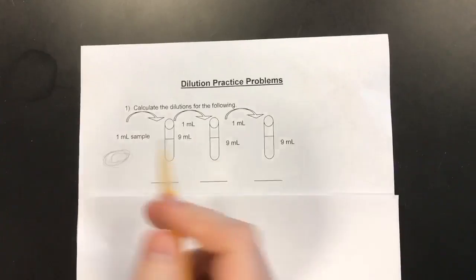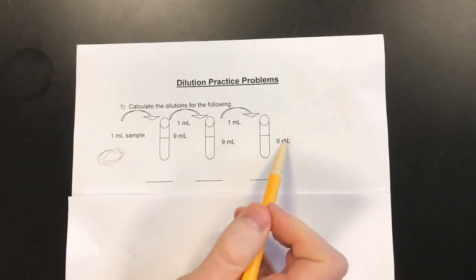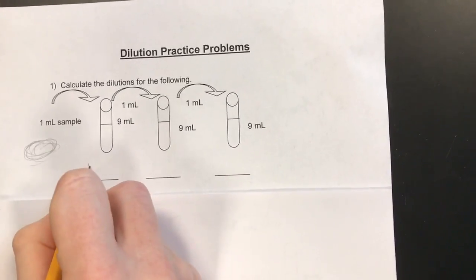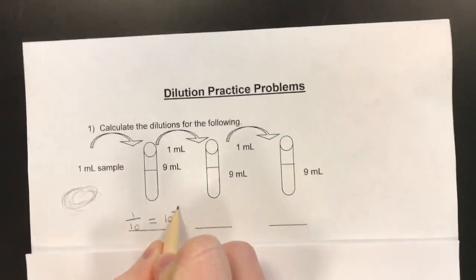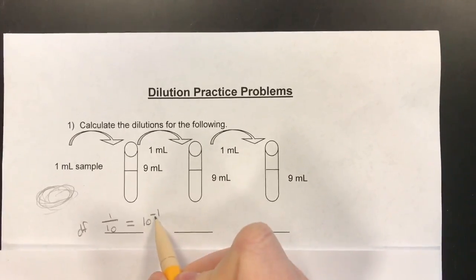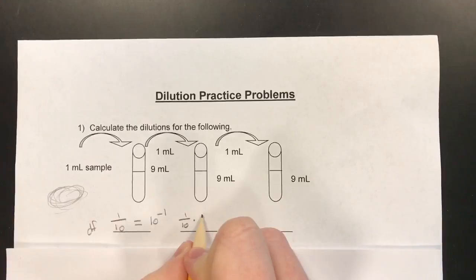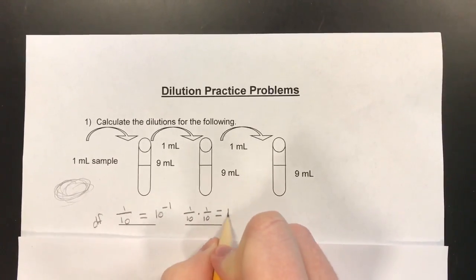So this is an example of a dilution scheme. Over here is the original sample and each time there's a milliliter pipetted into the next one. For the first one it's going to be 1 milliliter to 9 milliliters, so 1 plus 9 is 10, making it 1 over 10, equaling 10 to the negative 1 — so here's the DF, or the dilution factor. For the next one you're going to take that 10 to the negative 1 and multiply it by another 1 to 9, which is also 1 over 10. Those are multiplied together to get 10 to the negative 2.